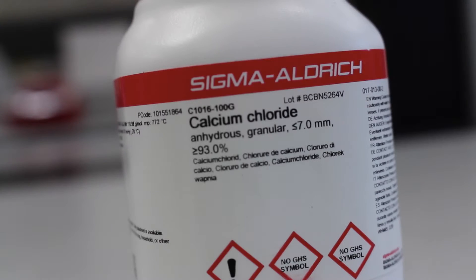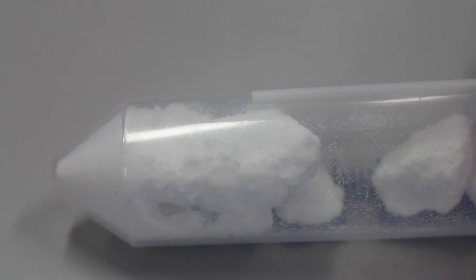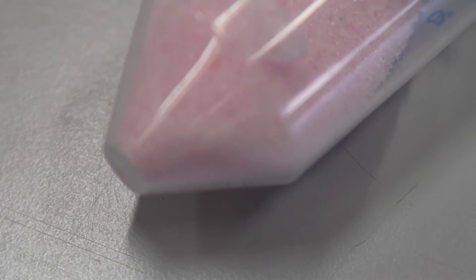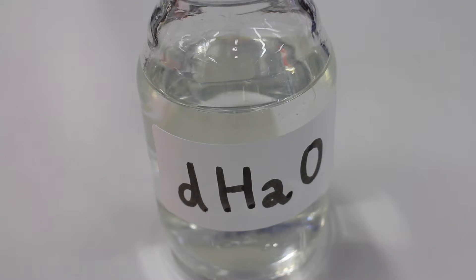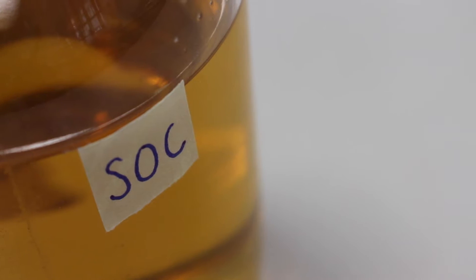Calcium chloride. Potassium acetate. Manganese chloride. Magnesium chloride. Distilled water. SOC medium, which you can learn how to prepare by clicking the link. And glycerol.